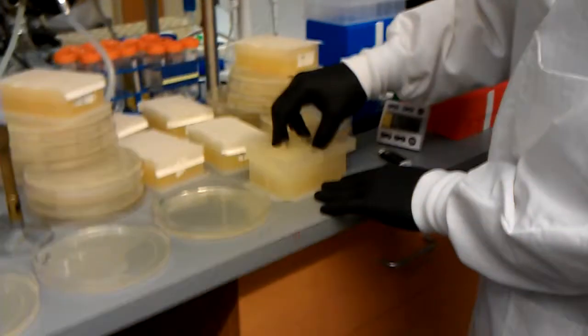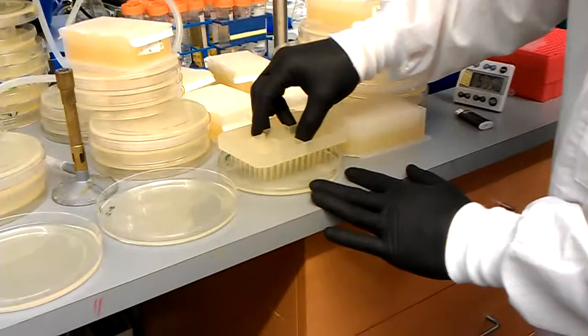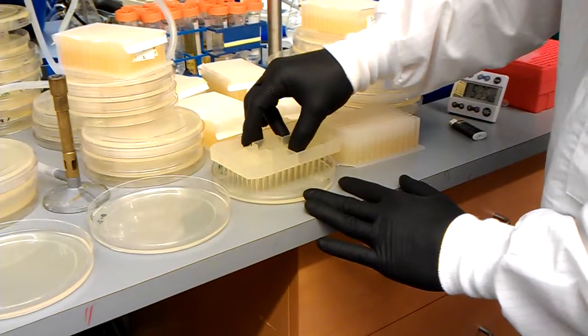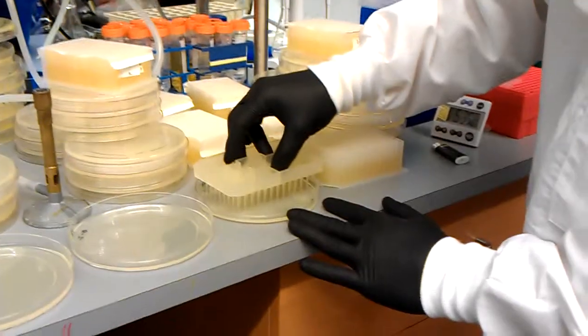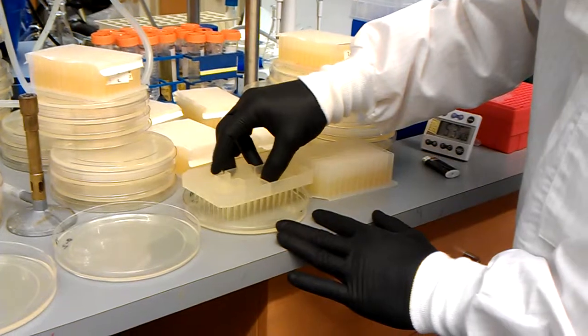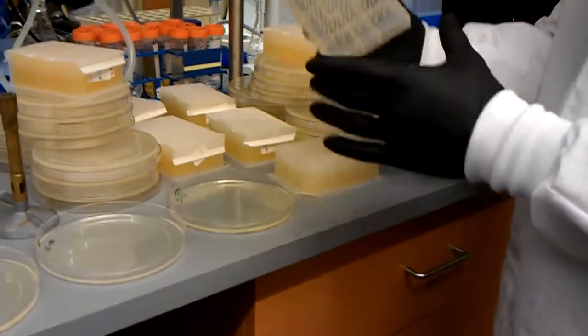So, back into the 96-hole block. Pull it up. And I'm going to get a little squiggle on this one too. And that's how you do it.